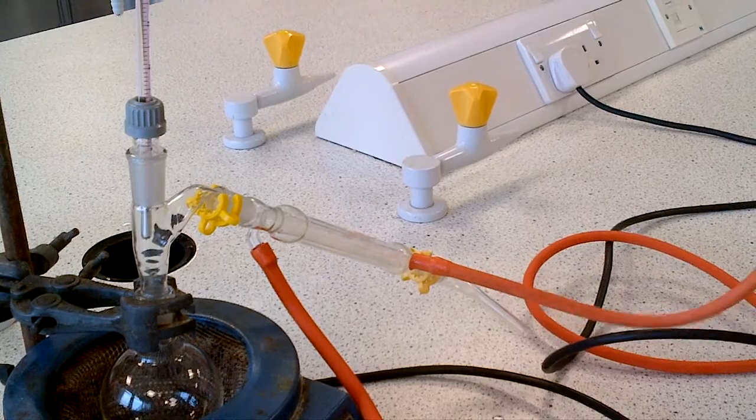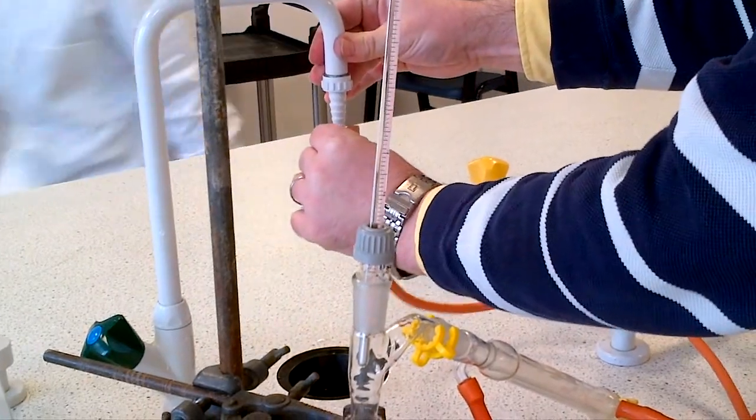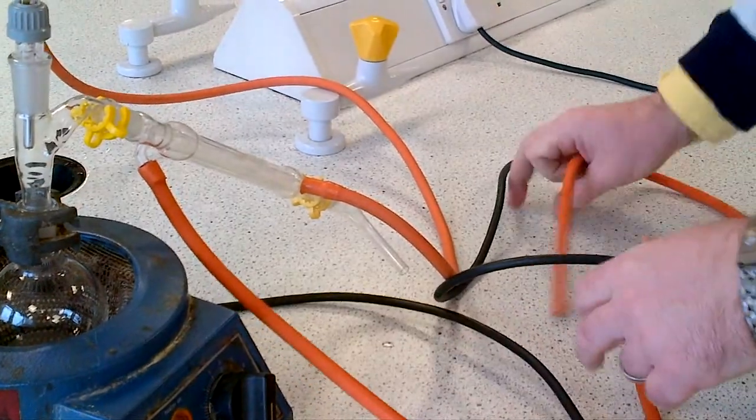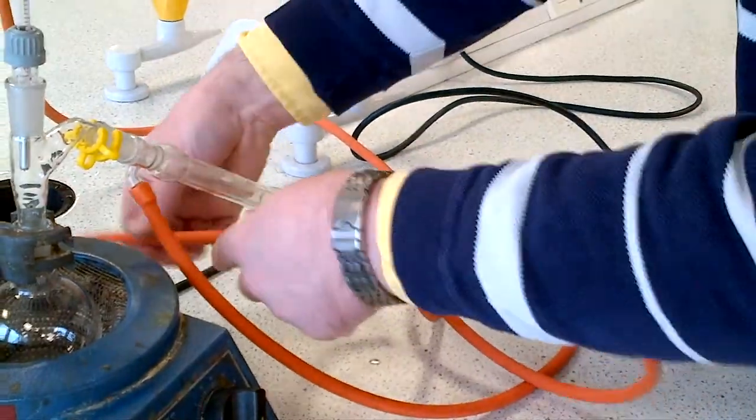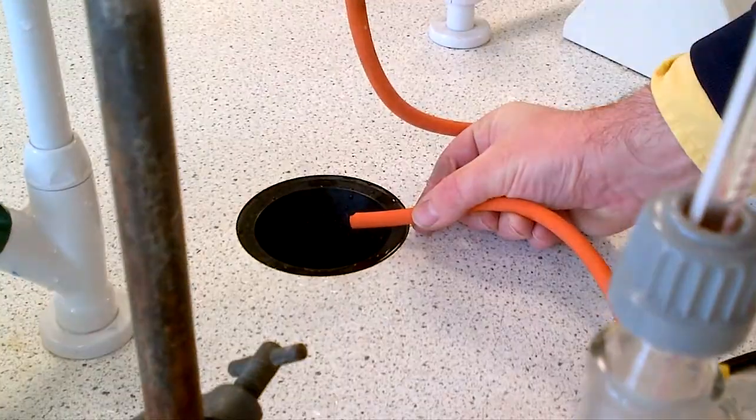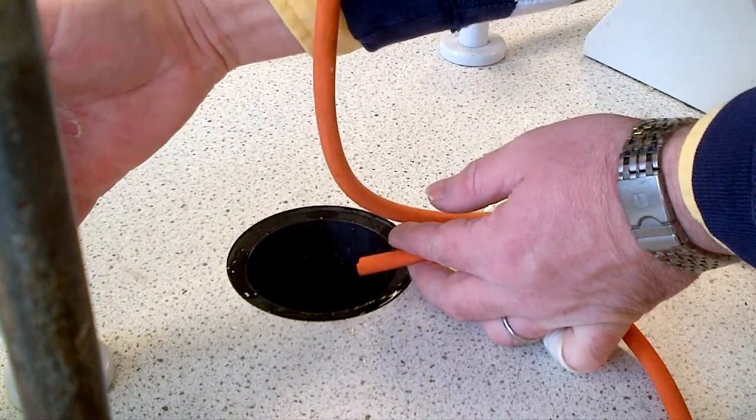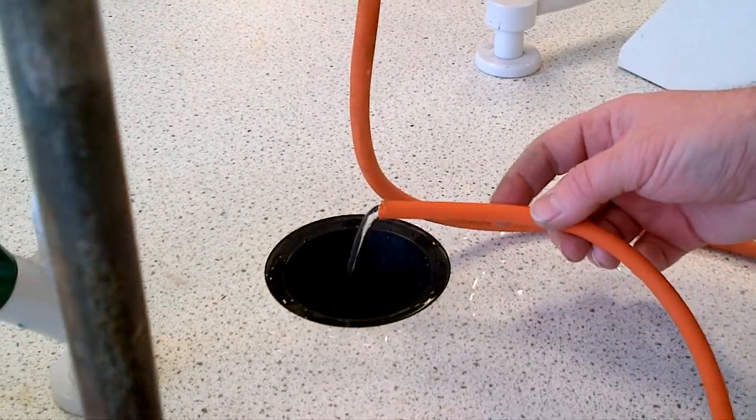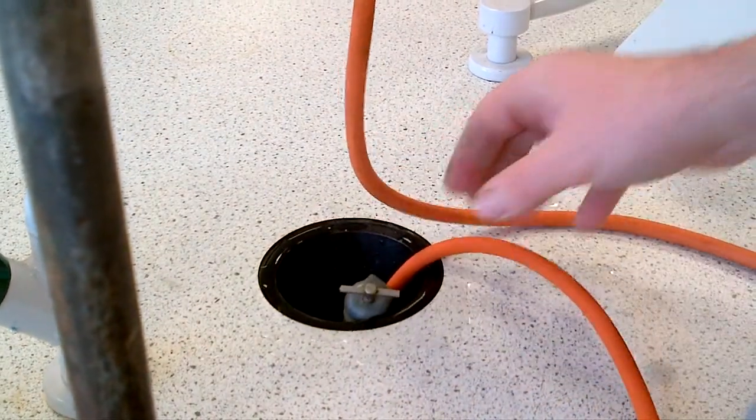Water goes in at the bottom from the tap, and water leaves by the top. Make sure you have a nice steady trickle of water coming out—not too fast, just a steady trickle.